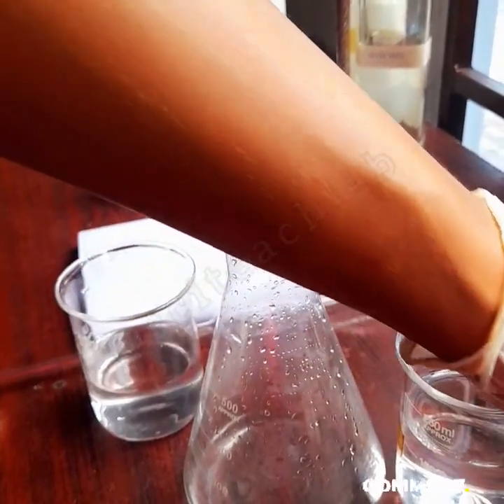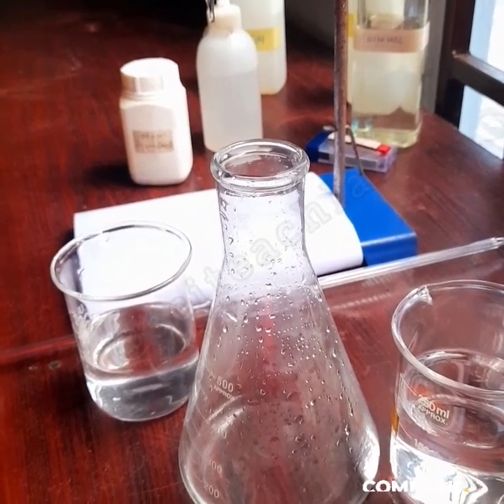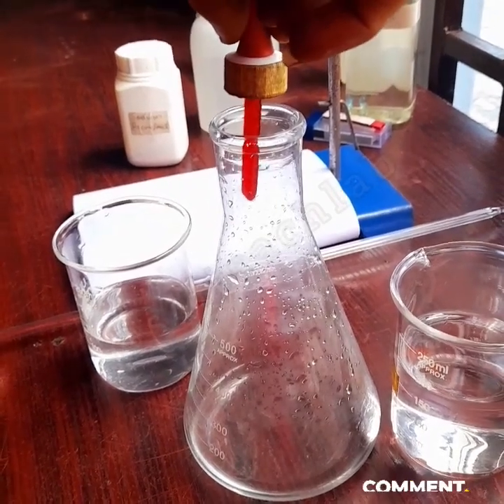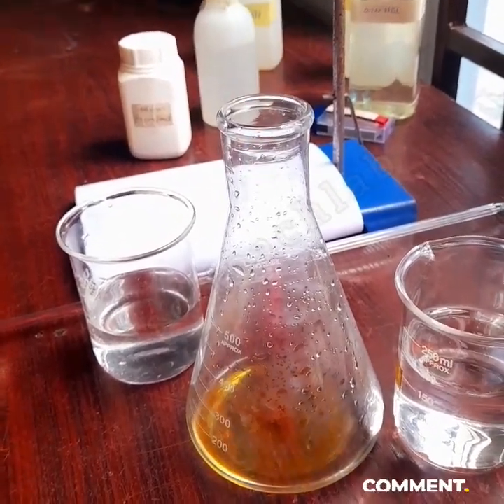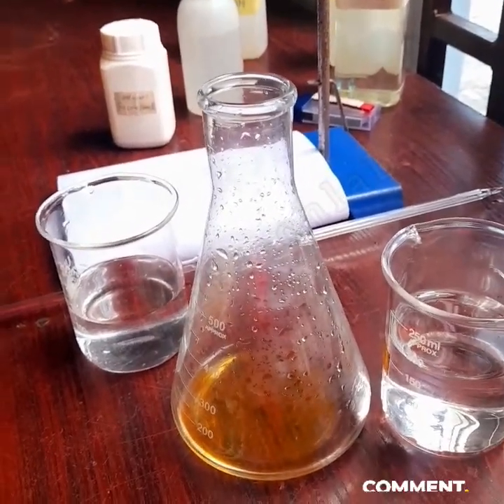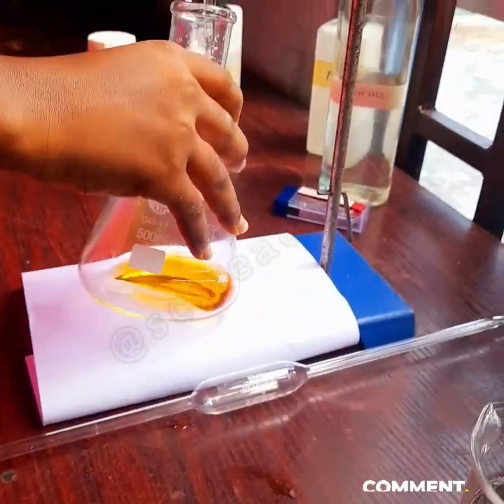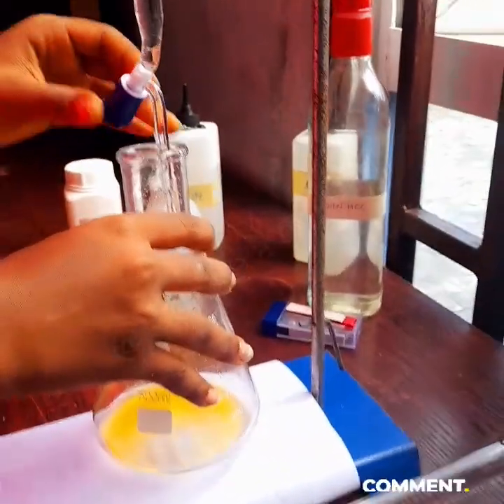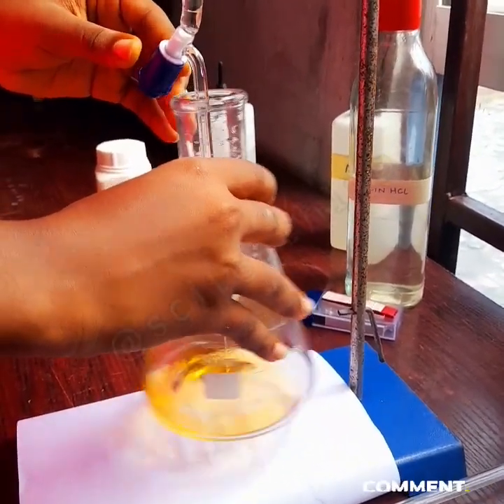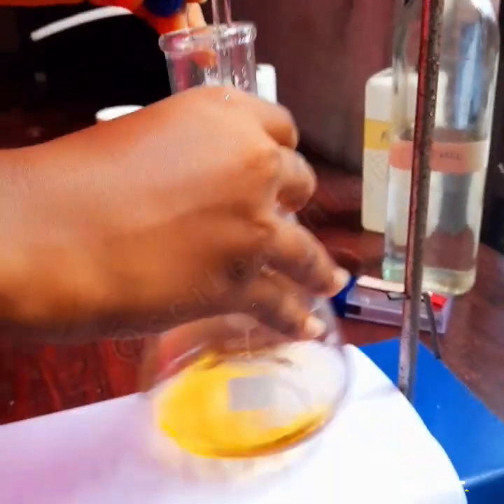And after you do that, remember we're using methyl orange, so it depends on the concentration. Mine is very thick, so 1 or 2 drops should be enough. So if I drop 1 and it's dark enough, okay, that should do. So I've put in my methyl orange, which will enable me know the end point. The end point is the point where you see the slightest color change. When it's no more orange color like this, then that is your end point. So observe this color at the start now, so that you'll be able to differentiate the end point.